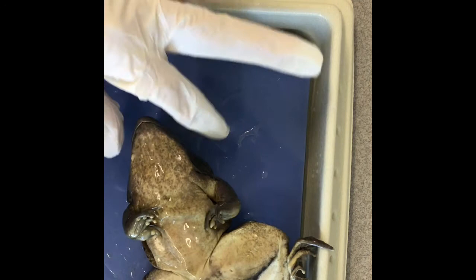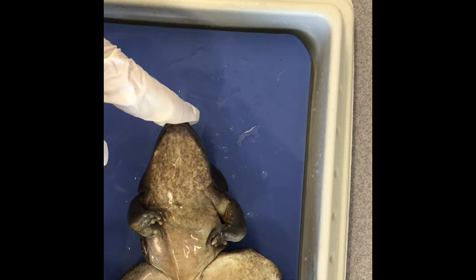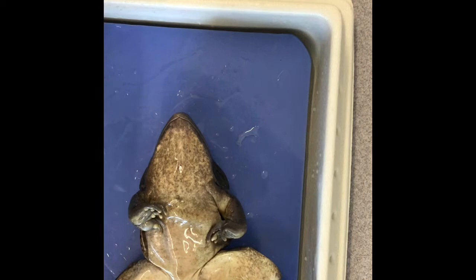On the outside of your frog, as we go through our packet, when you measure it, you're measuring from the head down to the butt essentially along the backbone. The length of the frogs we've had so far in the room have been about 11 to 12 centimeters.